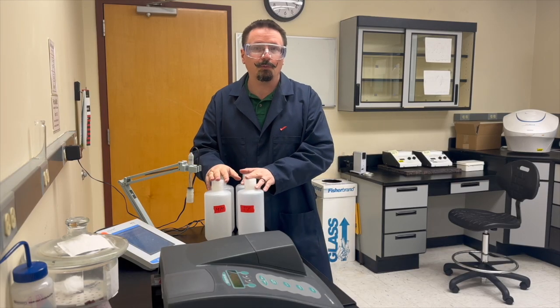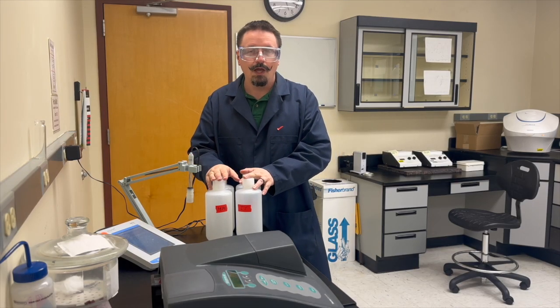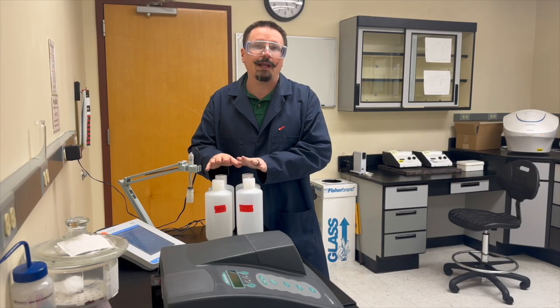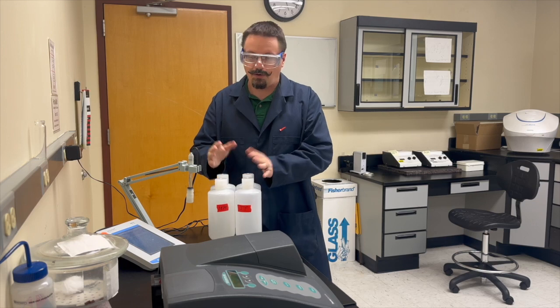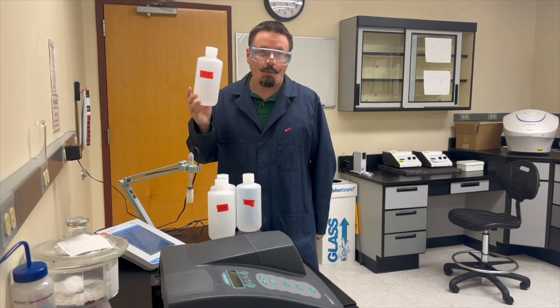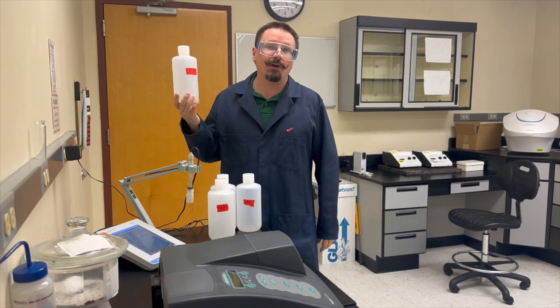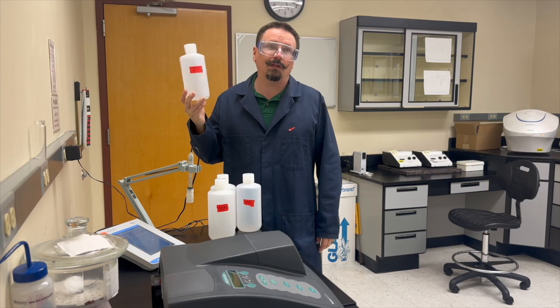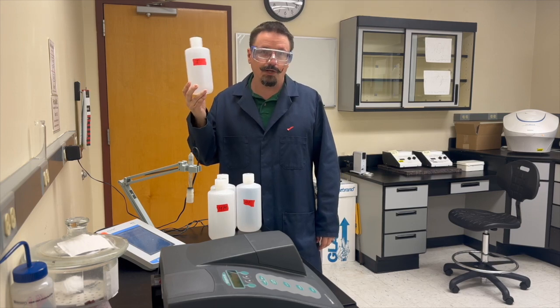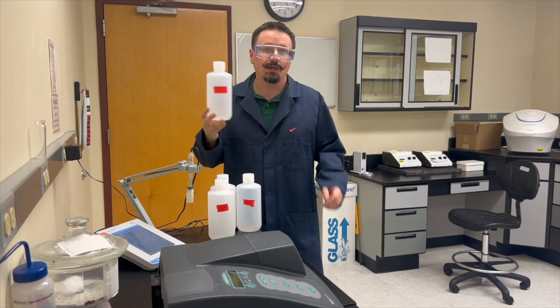You're going to work in a group of two. You and your partner are only going to analyze one of these waters — it could be any one you want, you'll grab whichever one. This is a one-liter container. You need 500 milliliters of liquid, so this should be enough for two groups.